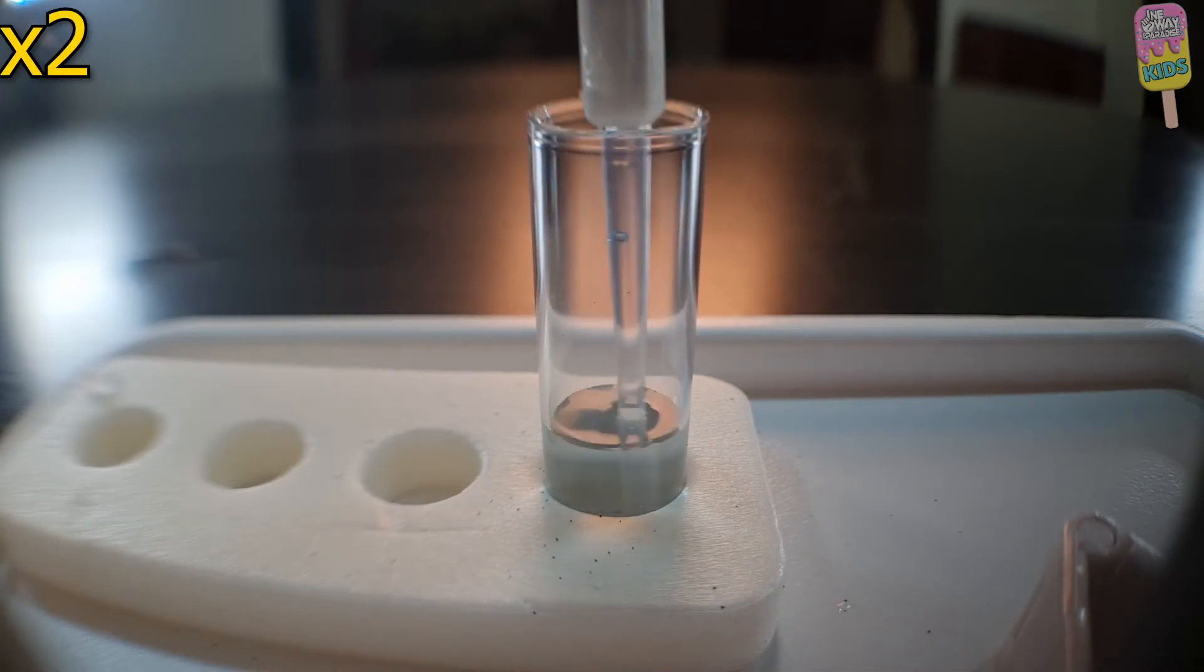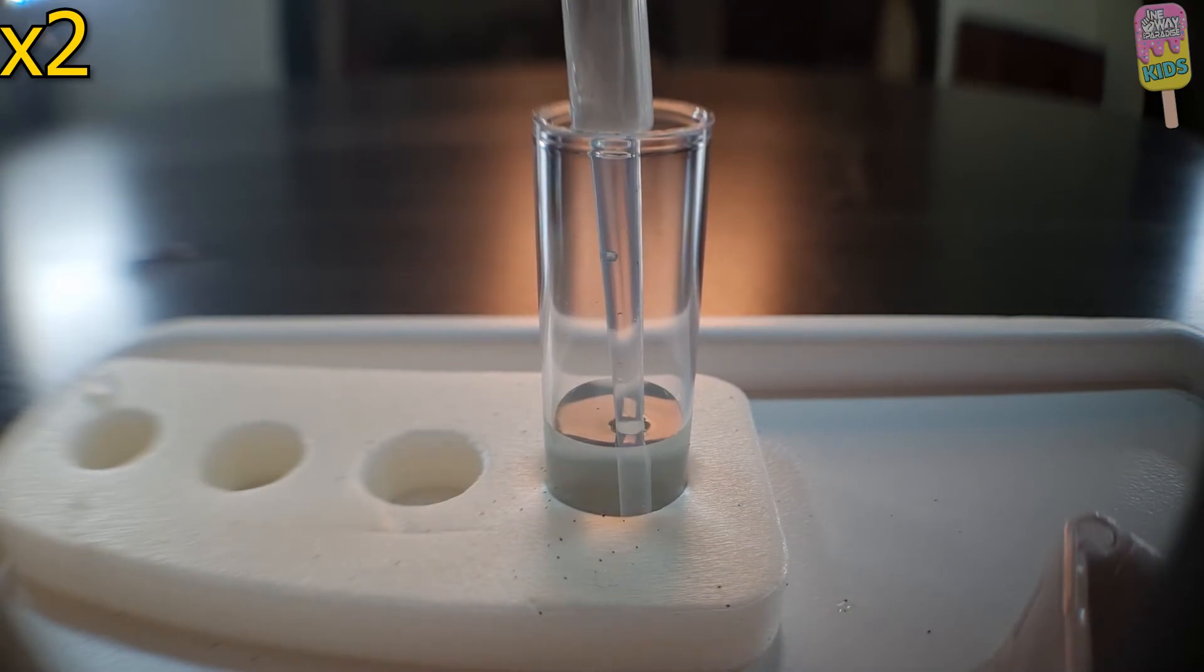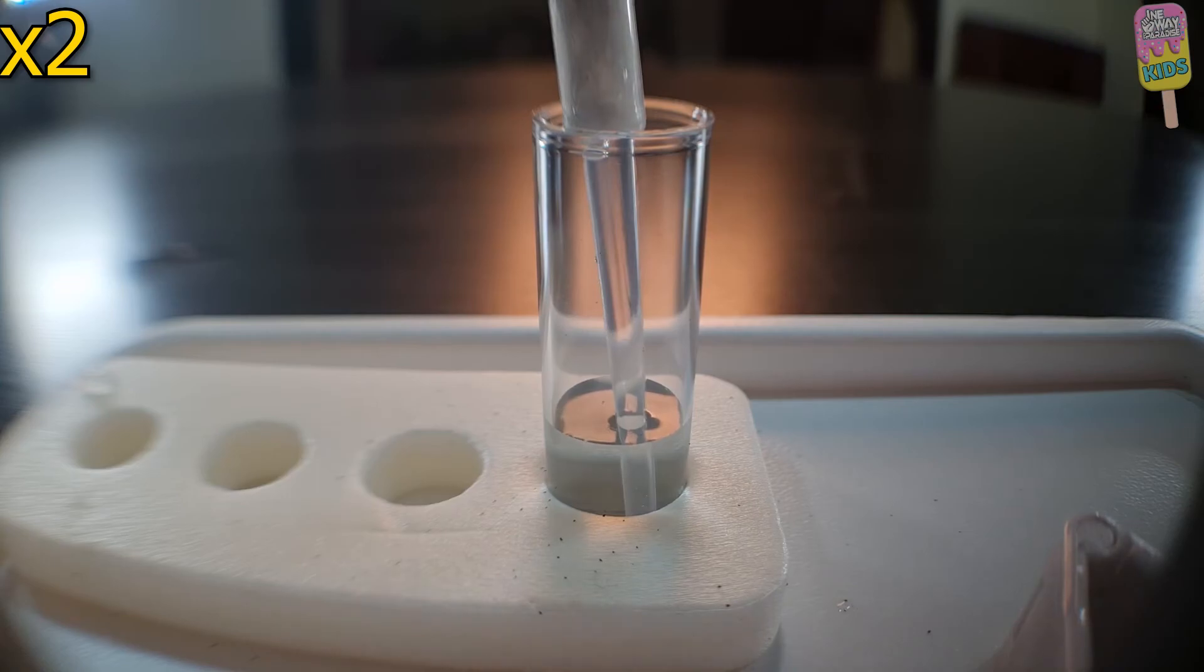Let me explain what's happening right now. Why does the solution become colorless? The activated carbon absorbs the molecules of methylene blue, the dye we use in this experiment. This reduces the concentration of the dye in the solution and makes the solution almost colorless.